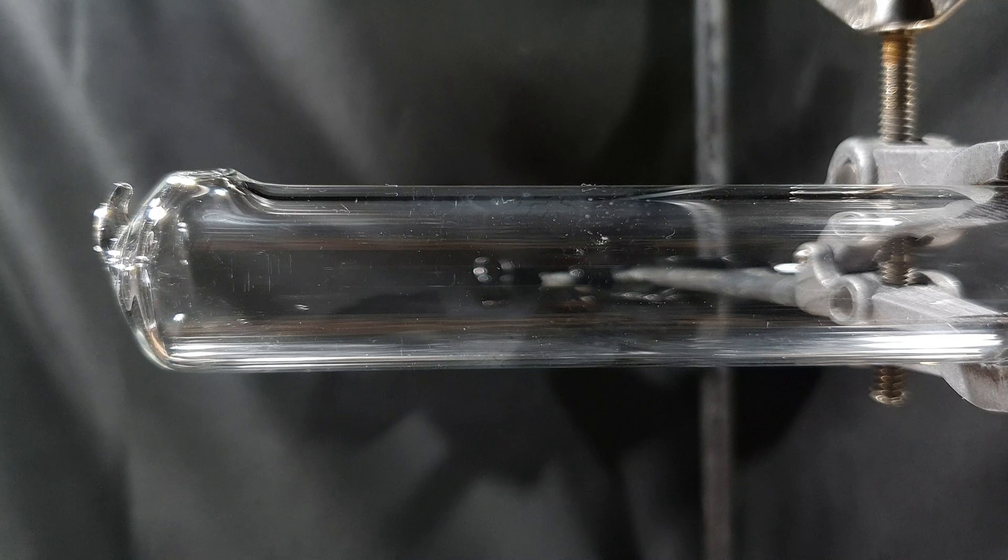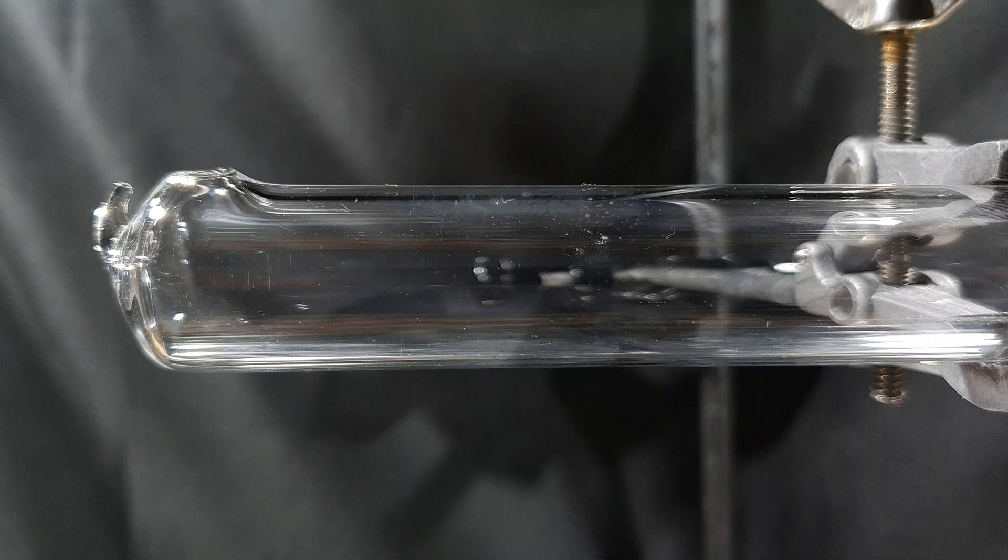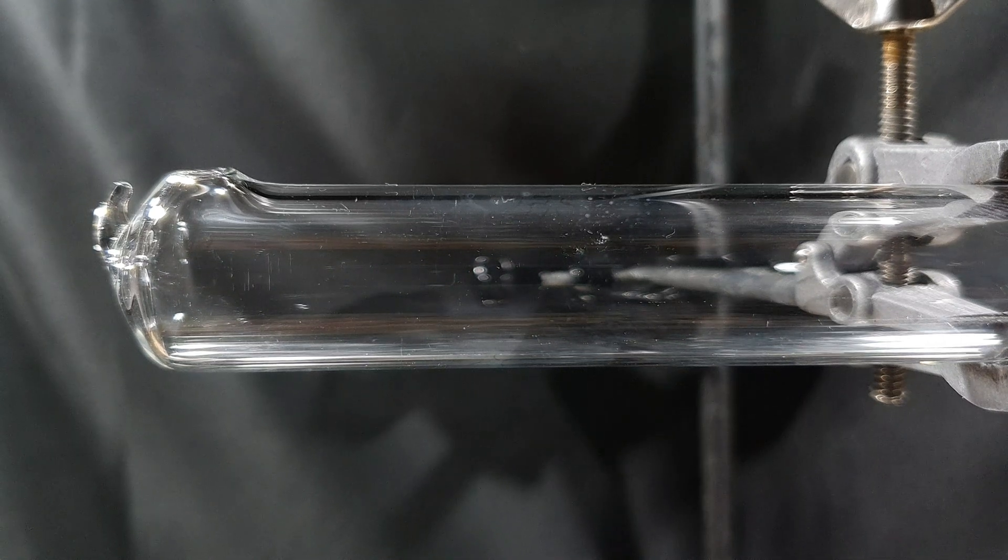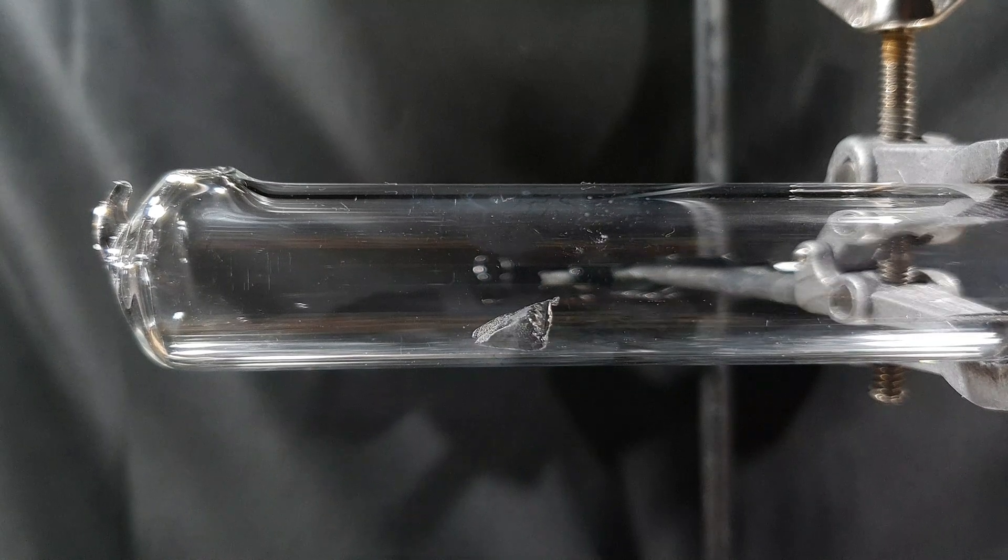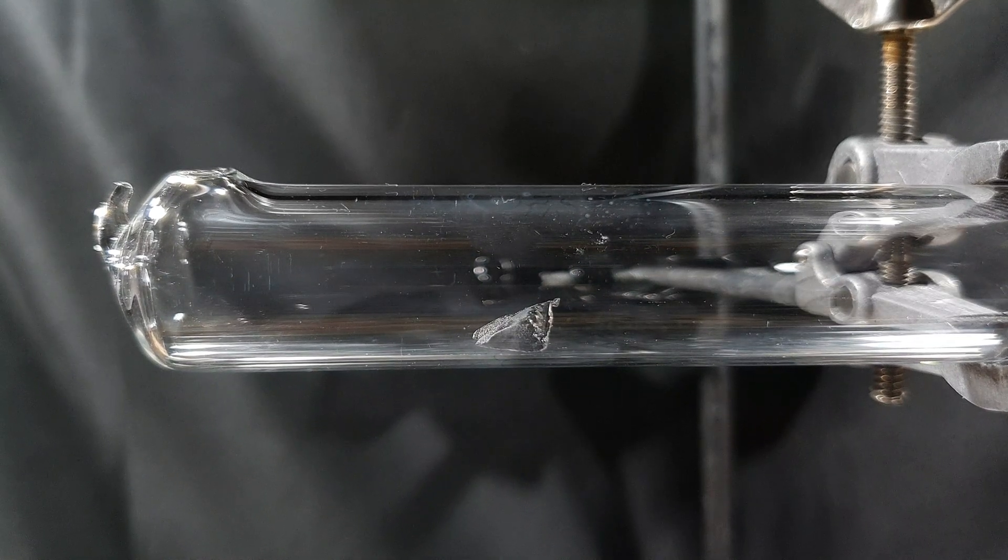For comparison let's look at the reaction of lithium with pure oxygen. For this I place a piece of lithium in a glass tube with two openings. Pure oxygen is introduced at one end and at the other end the exhaust products can escape.